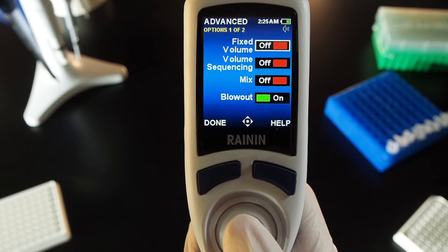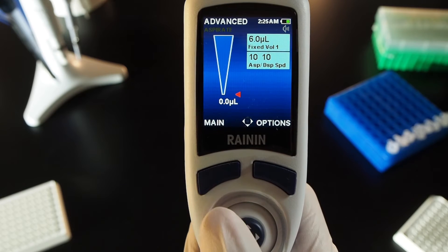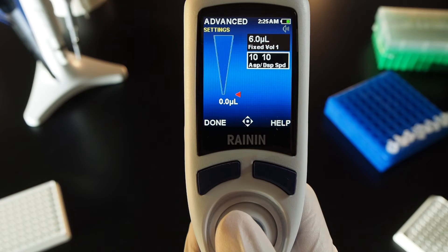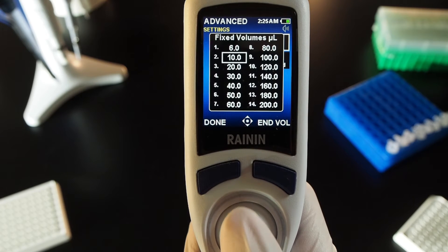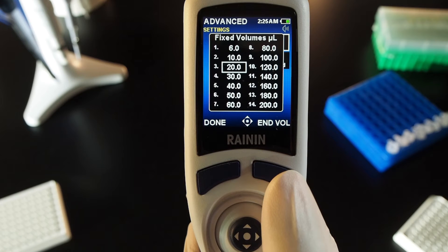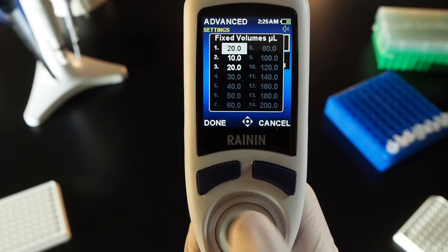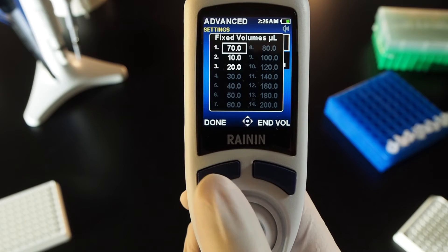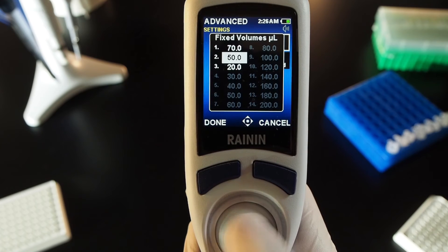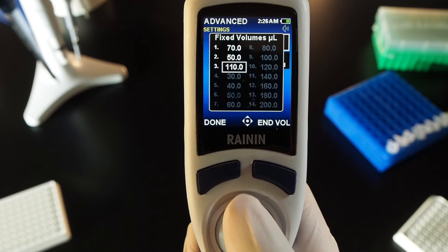Use and save fixed volumes. Press the button on the right — Options. Press the joystick in to turn fixed volumes on. Then push done on the left. Joystick right to go into settings, then push up to the fixed volume 1 box and press the joystick in to open a list of fixed volumes. Joystick to the last fixed volume you want to set, then press the right side button — End volume. Joystick to a volume and press the joystick in, then joystick left or right, up or down to adjust the volume. Press done to set that volume and move to another. When each volume is set, press done again to exit the fixed volumes list.